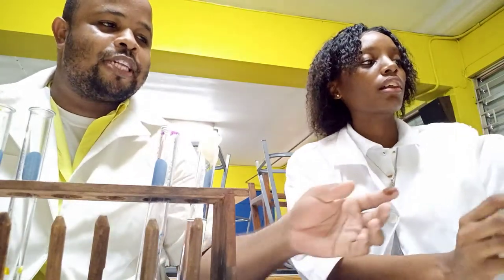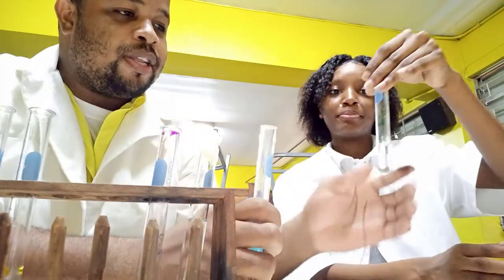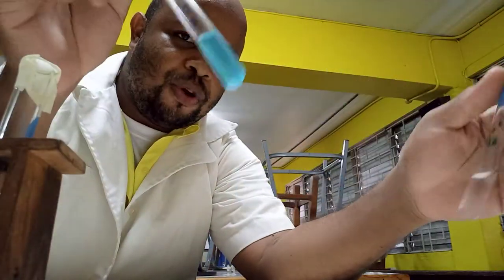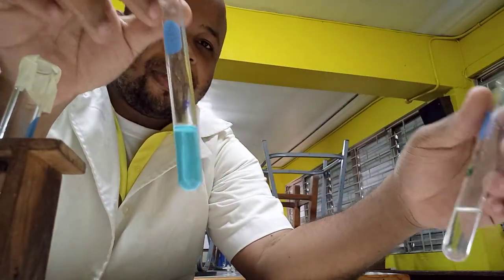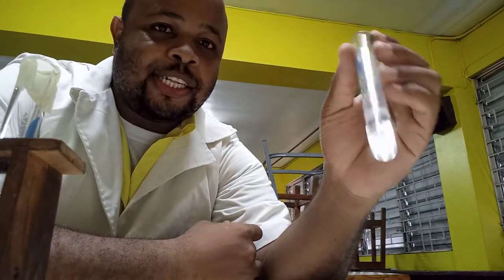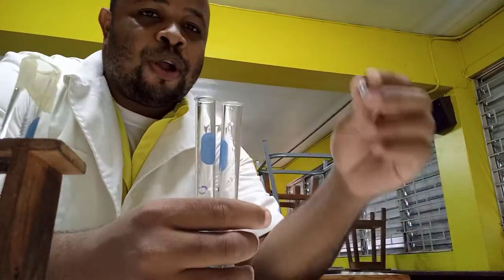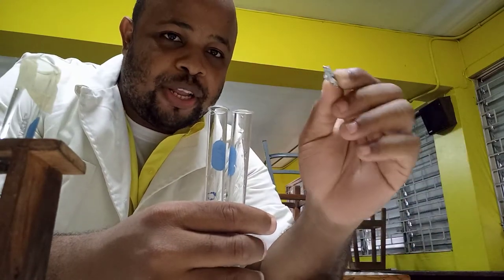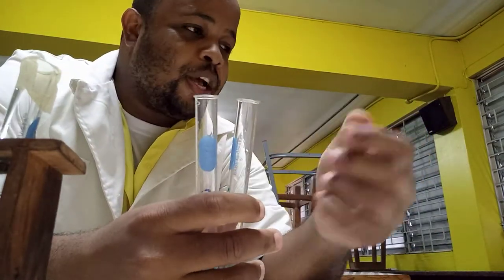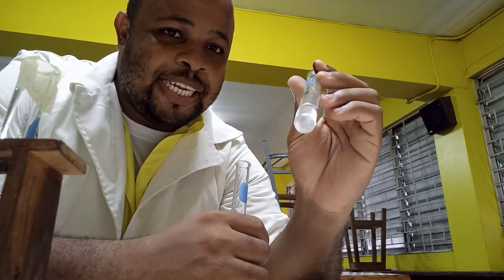For the first two experiments, we have two solutions: one is copper sulfate and the next one is zinc sulfate. We are going to add zinc metal to the copper sulfate and copper metal to the zinc sulfate.